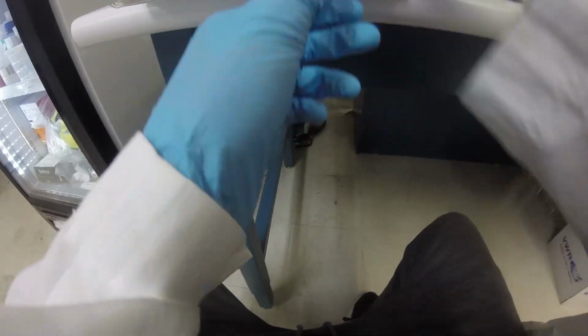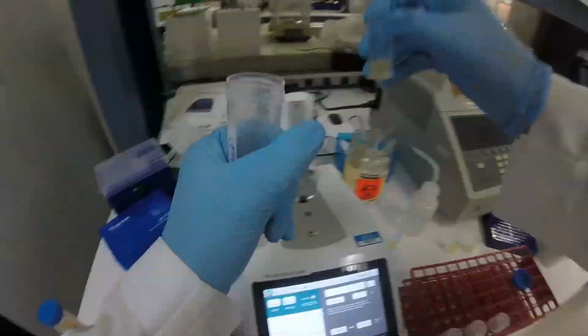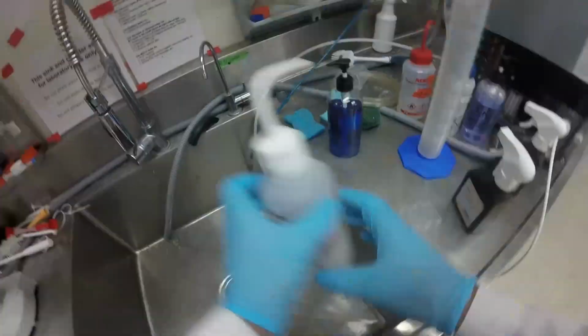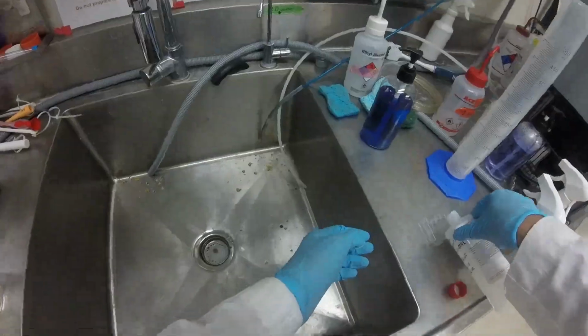is apparently very important. But I was noticing contamination in it and I dropped the whole thing yesterday. I was just so discouraged. I guess it's probably a little bit of a rite of passage to get contamination. By the way, right here, this is hilarious.